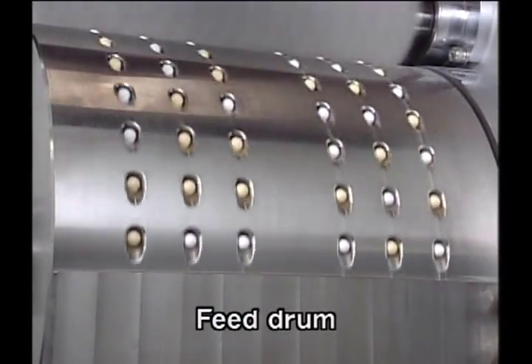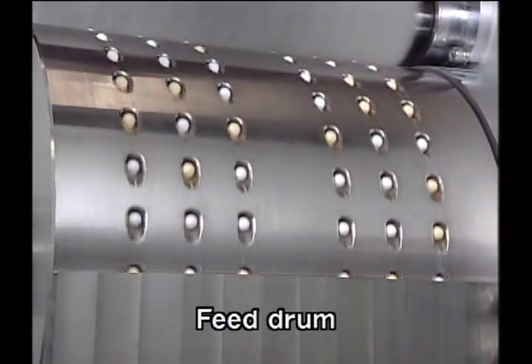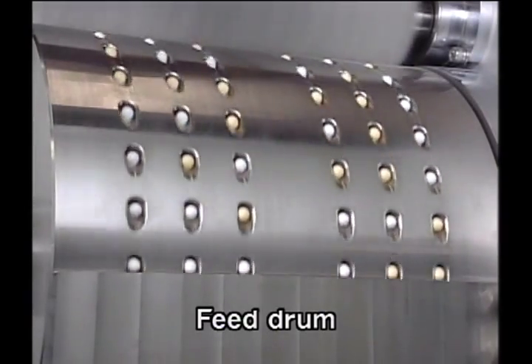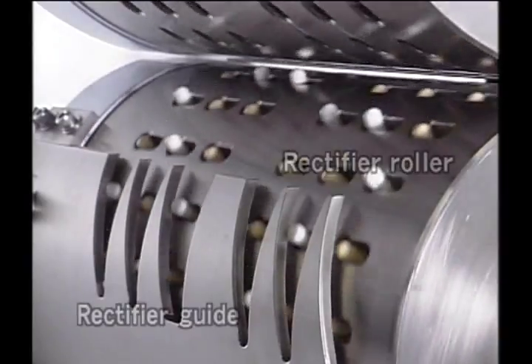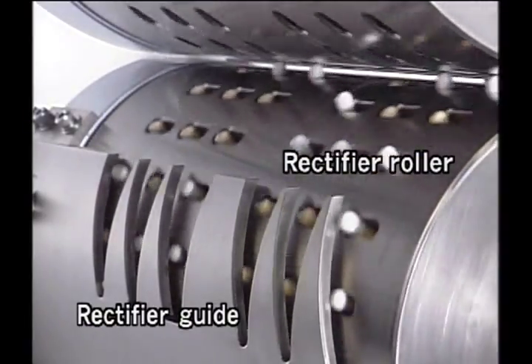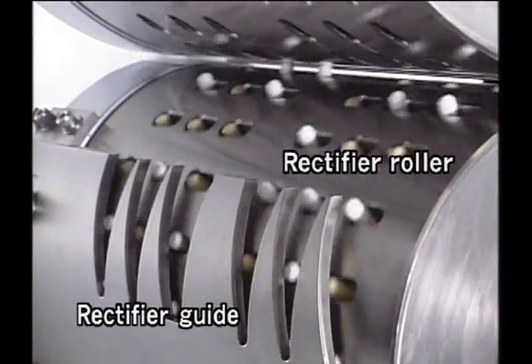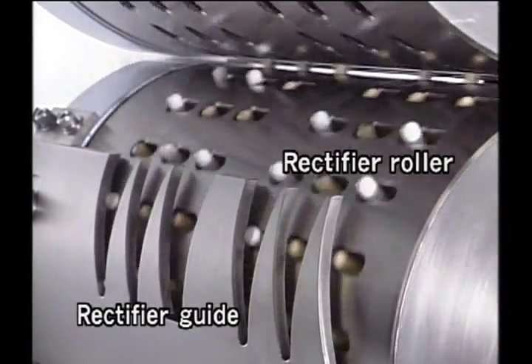Capsules that enter the hopper are fed into the supply drum. Then the next step is to feed these capsules into the rectifier roller. At this time, the direction of the capsules is regulated by the rectifier guide.